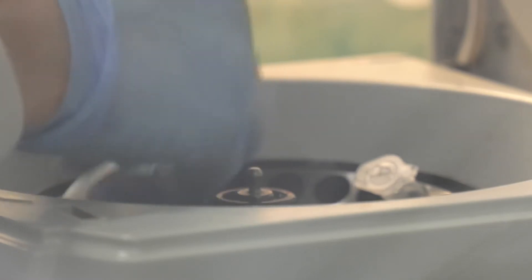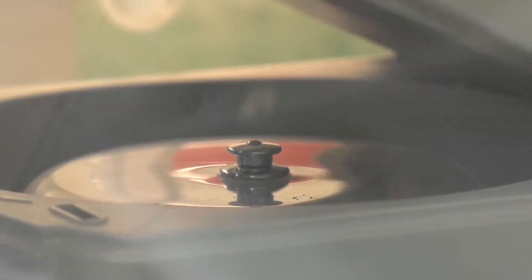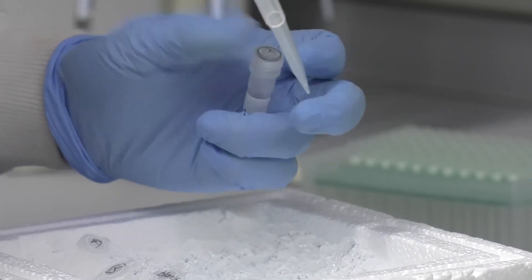Step 7. After cell lysis, remove protein and cell wall debris by centrifuging at 13,000 times G for 3 minutes, and transfer the supernatant to a screw-capped tube.